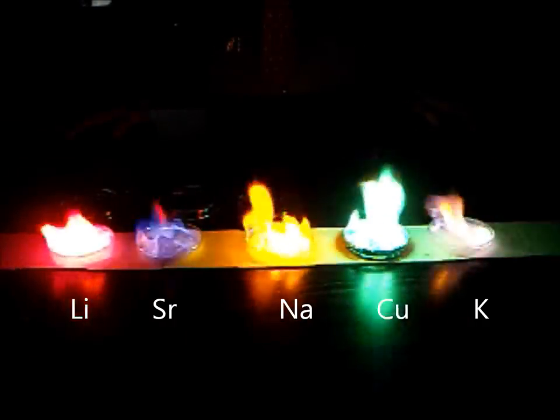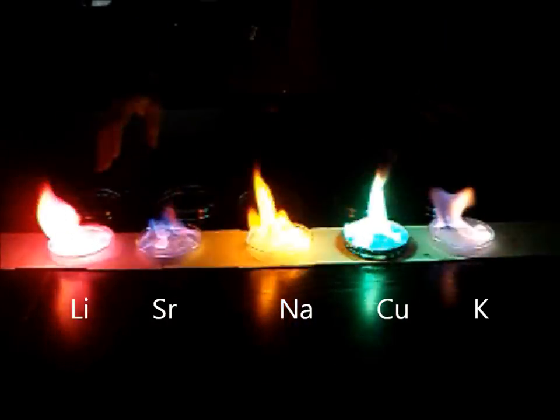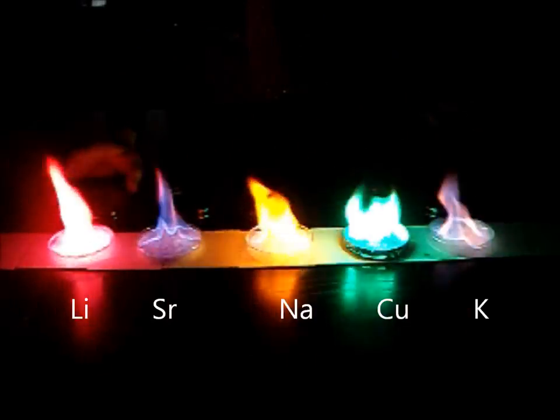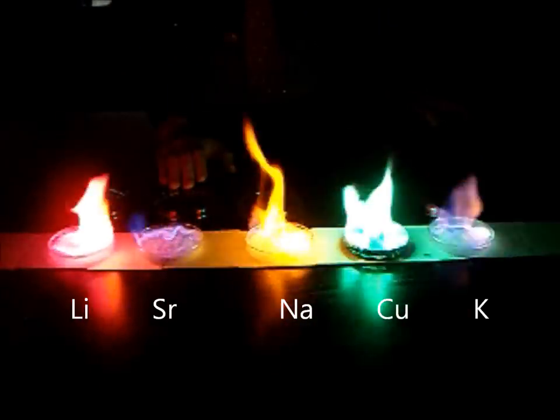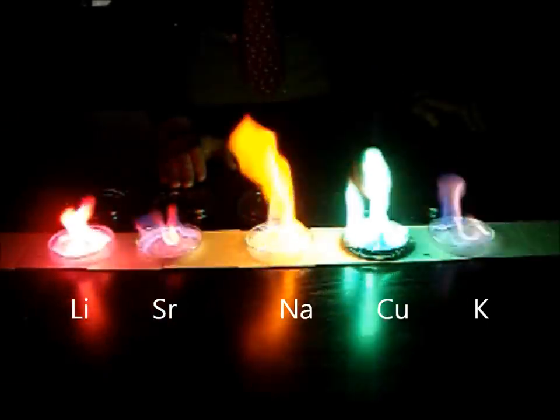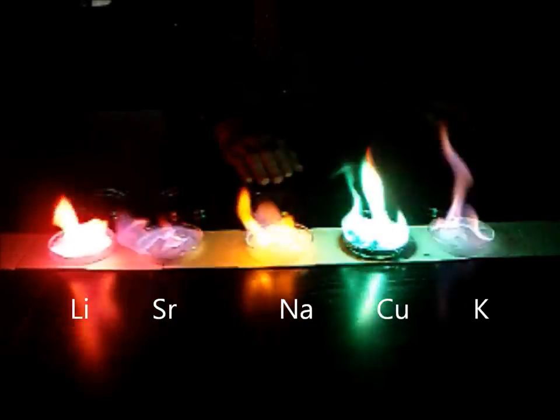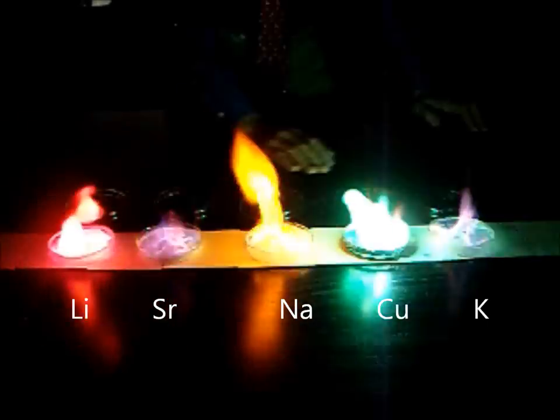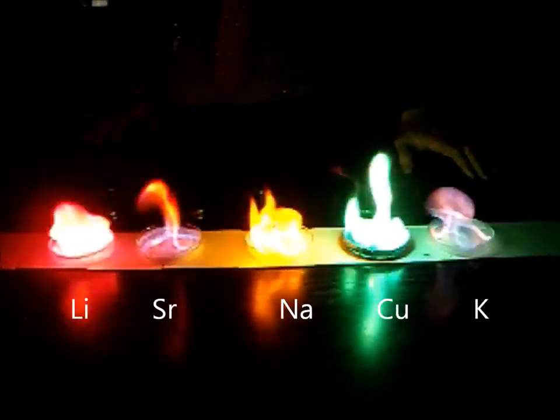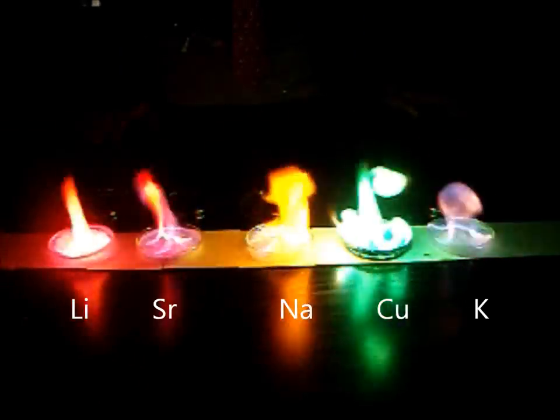The potassium chloride, actually let's start over here with the lithium chloride. Lithium chloride is pink. Strontium chloride should go to a nice orange color as it dissolves. Sodium chloride is that nice yellow. Copper chloride is green. And potassium chloride, you're getting a violet.